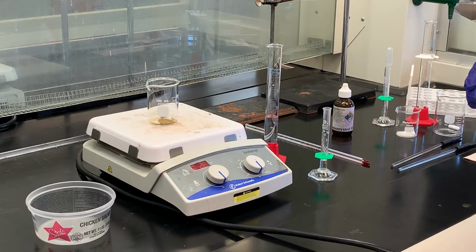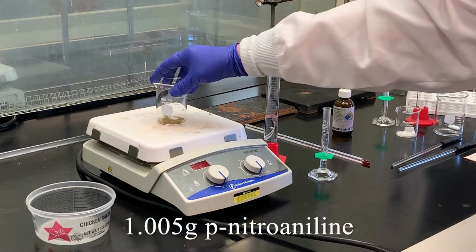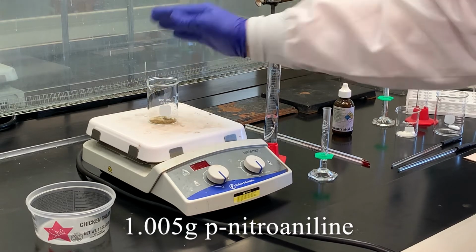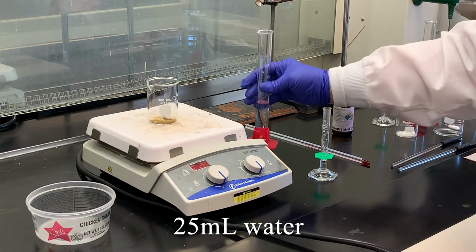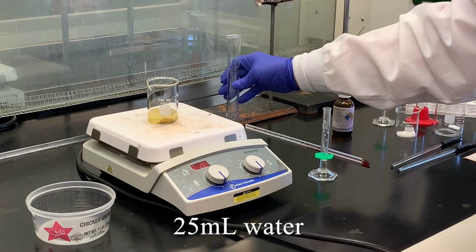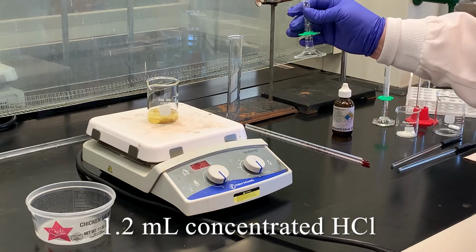The first step in the dye synthesis is that we need to prepare our diazonium salt. And so what I have here is 1.005 grams of the para-nitroaniline. I put that in a small beaker equipped with a stir bar. To that I'm going to add 25 milliliters of water. And then also 1.2 milliliters of concentrated hydrochloric acid.